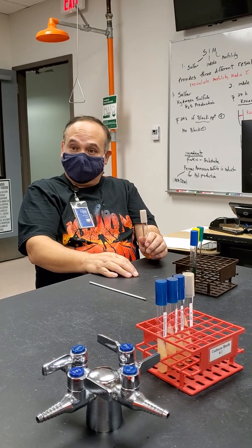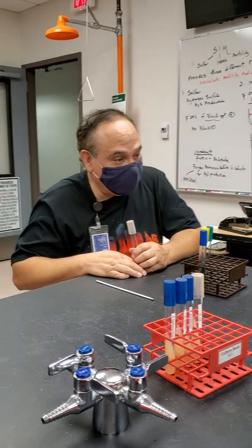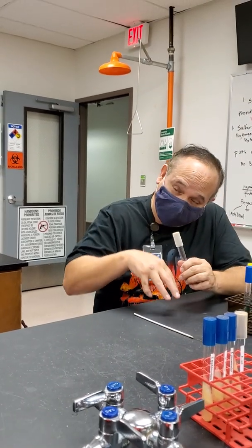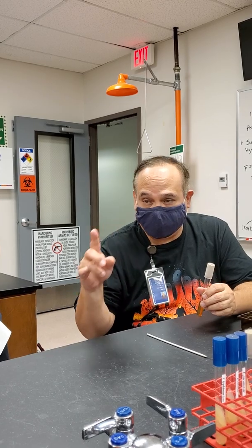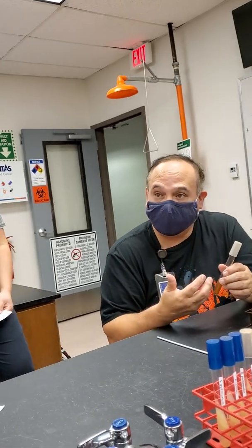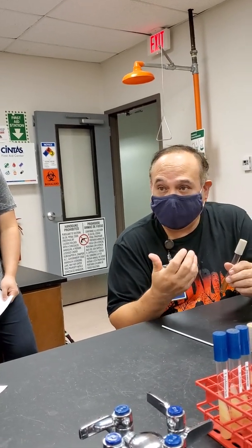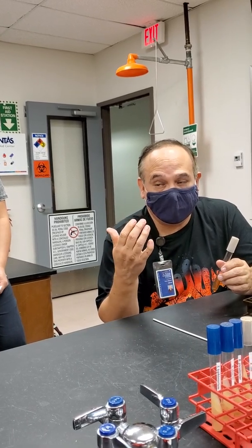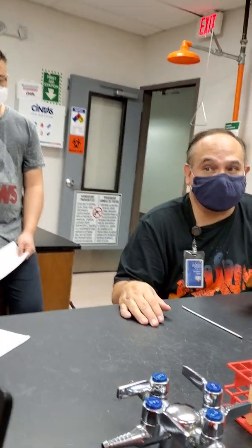You can't really see motility if it turns all black though, can you? That's right. So for the scope of this course, if we take it and it turns all black, we're going to assume it's motile. But it's not true because the gas permeates the entire media and it's going to react with the iron in the media, so it's going to turn completely black. You would have to do an additional motility test to determine that.